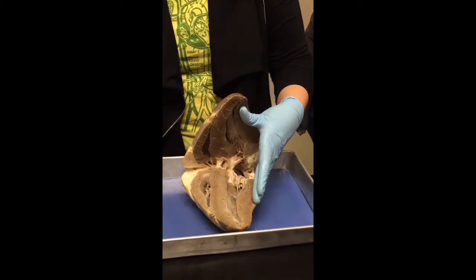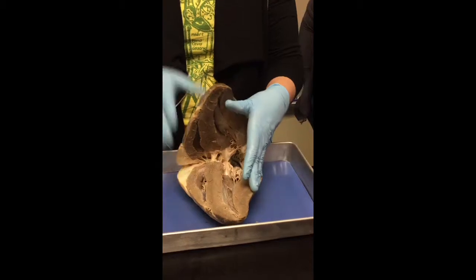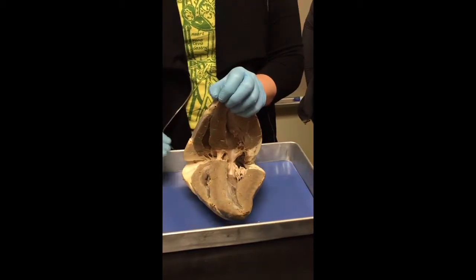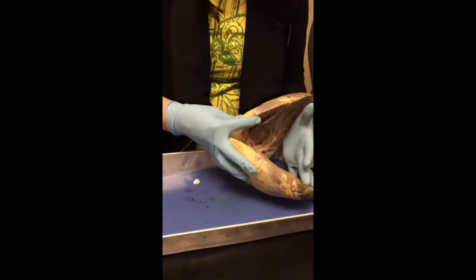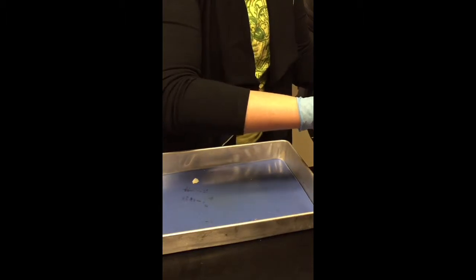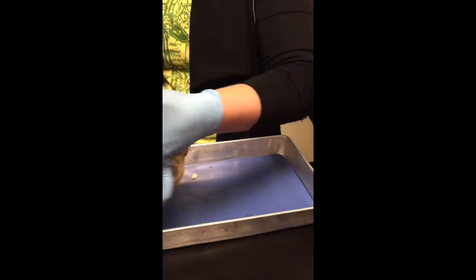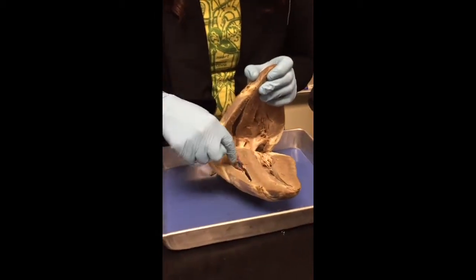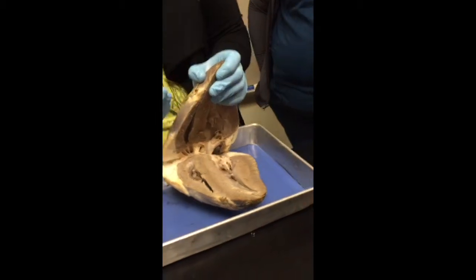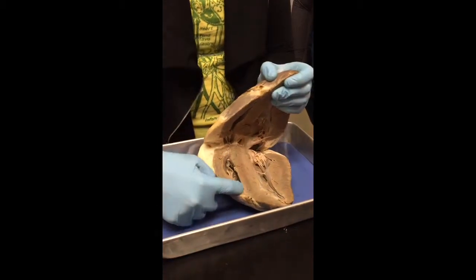So in through the inferior and superior vena cava and coronary sinus, into the right atrium, the atria will contract. The blood is going to go through the tricuspid valve, which y'all see deep in there. The tricuspid valve with the chordae tendineae and the papillary muscles. Okay, so through the tricuspid valve, tri because there's three, and it's on the right side, into the right ventricle, which is right here.